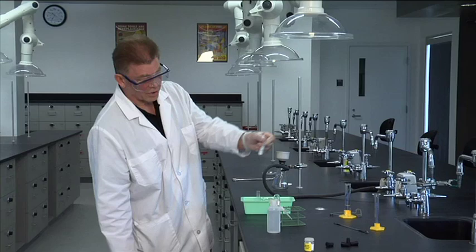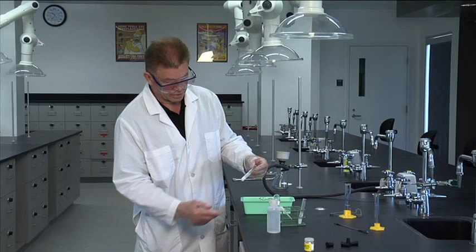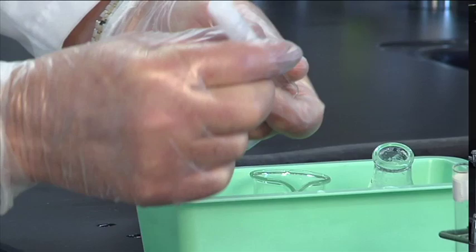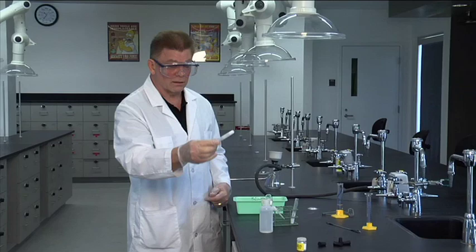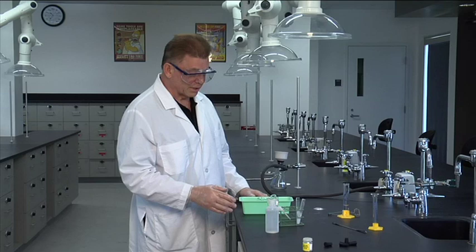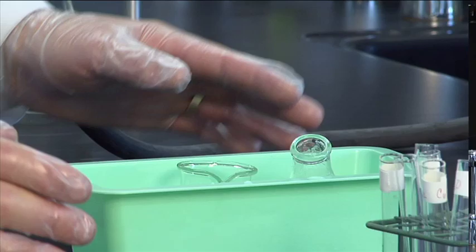Let's see what happened to the cyclohexane solution. I flick that around and can you see? That son of a gun's an ice cube. That's an ice cube. That's not going anywhere. So that, for our purposes, wouldn't be that good of a recrystallization solvent. We did get plenty of crystals at room temperature so it might be appropriate but you're in for a surprise if you put that in ice water. All right.